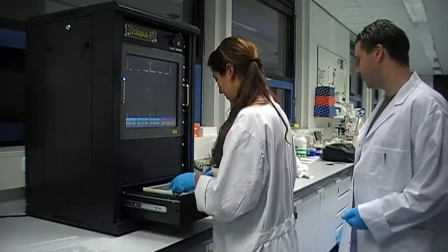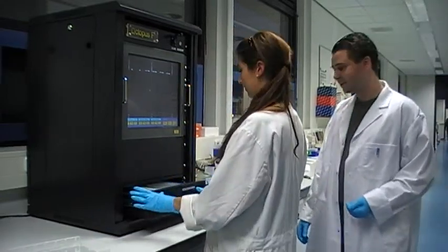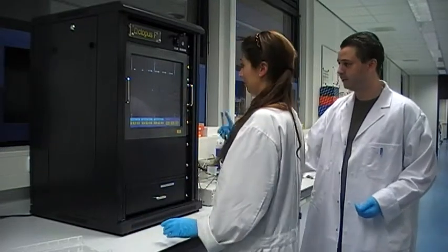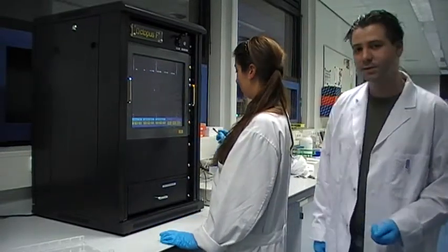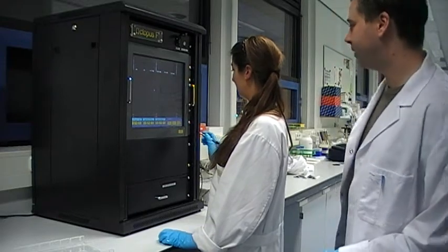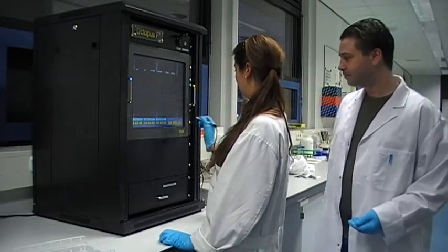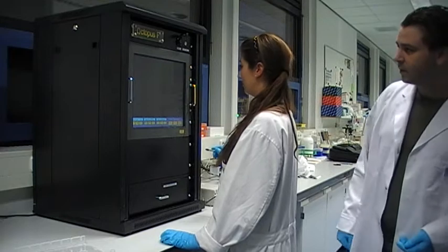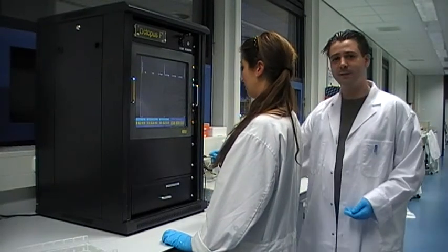Then you close the drawer and use the pen to interact with the touch screen. You should start with resuming the camera. Then the camera and the illumination system start up.